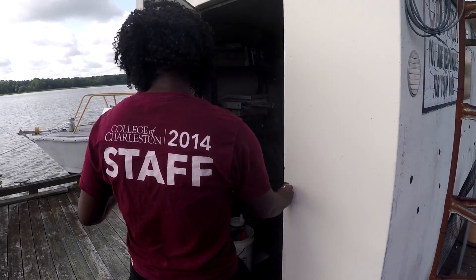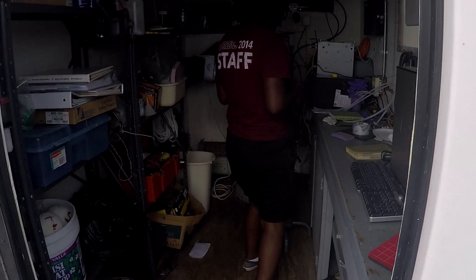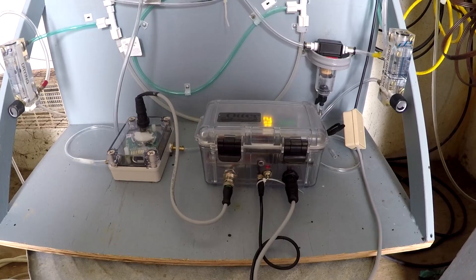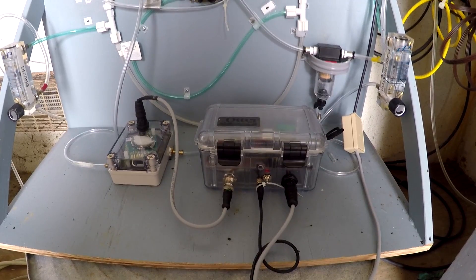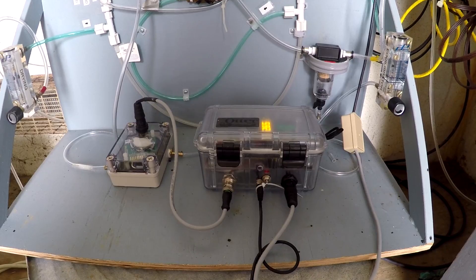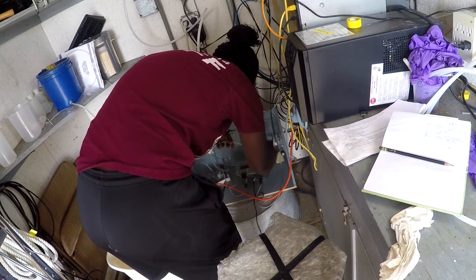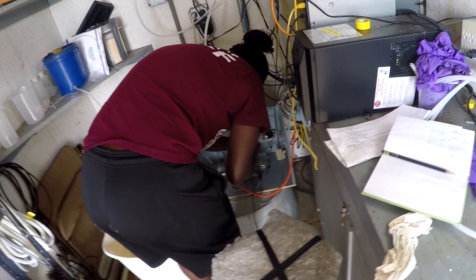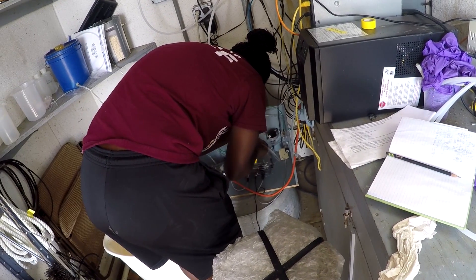The beauty of that is that the little infrared gas analyzer that you use is not soaking in the water, not getting biofouled, not seeing changes in salinity.